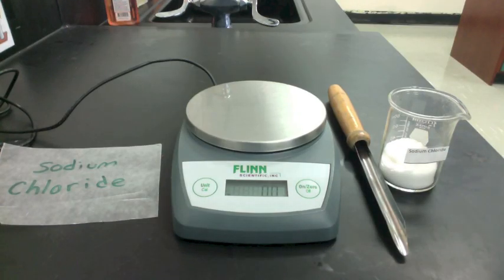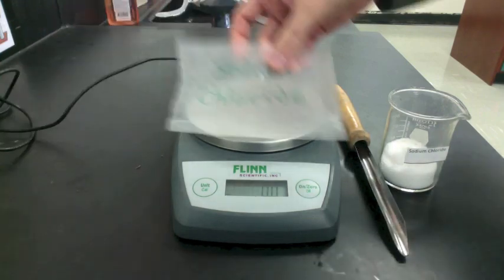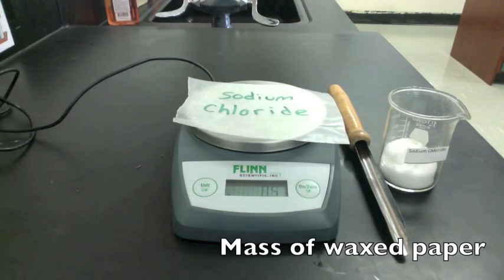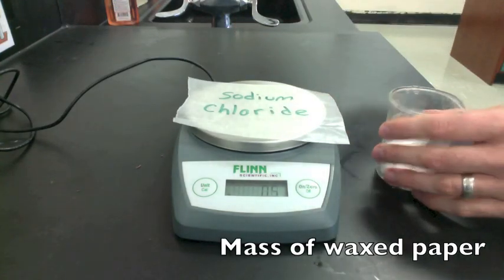To find the mass, first, we have to find the mass of the wax paper. It is 0.5 grams.